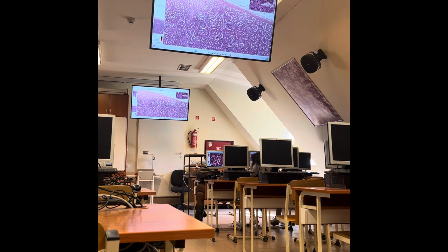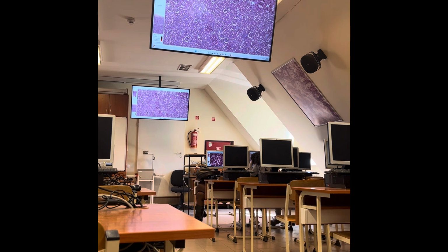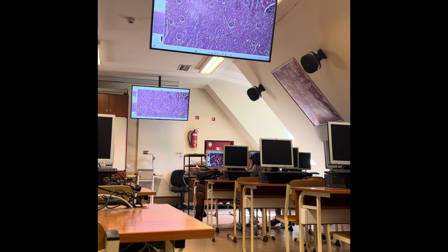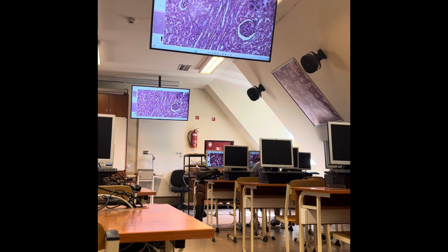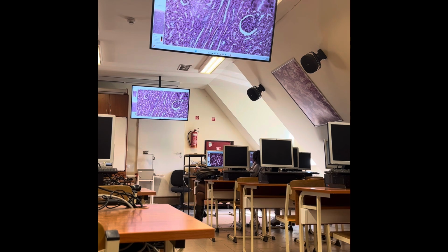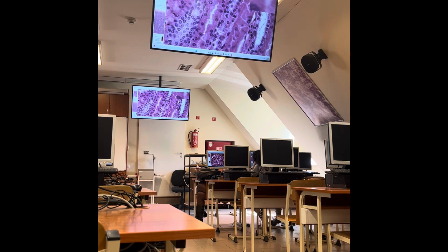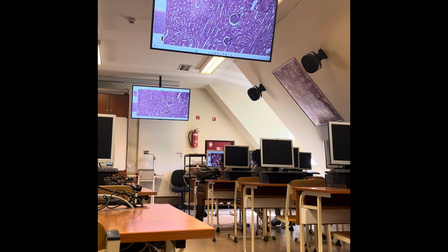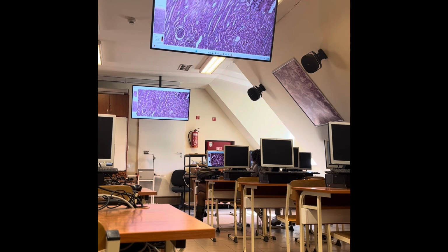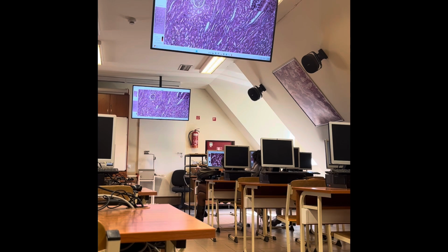Then the proximal convoluted tubule continues into a straight segment, and the straight segments we find here. What do you remember? What is the name of these? These are the medullary rays. Yes. So in medullary rays we can find the straight segment of the proximal tubules. That is the next part of the nephron. And then these form the descending limb of the loop of Henle. So they will travel towards the medulla. You still see the medullary ray.